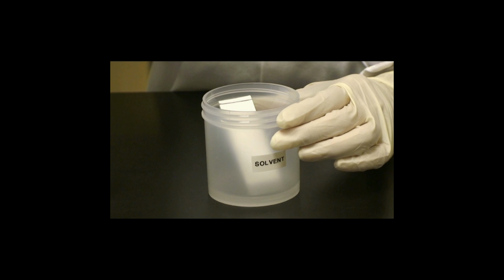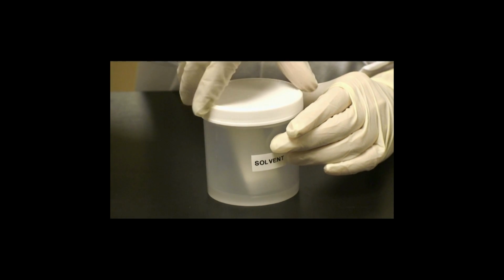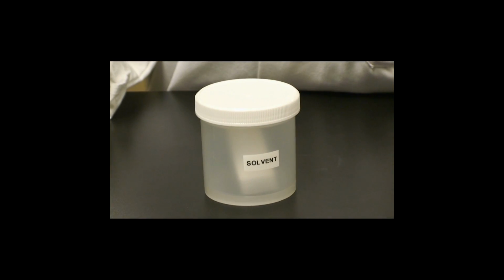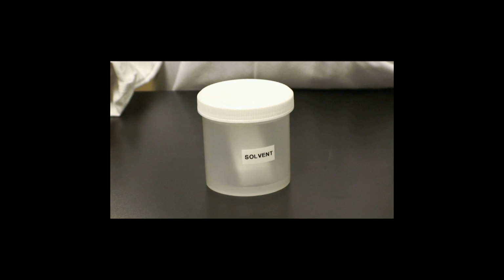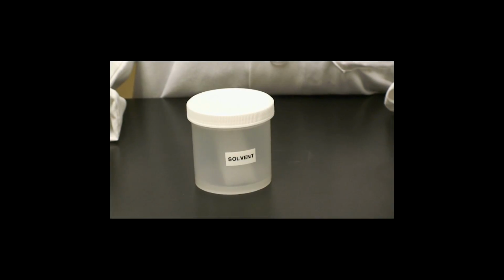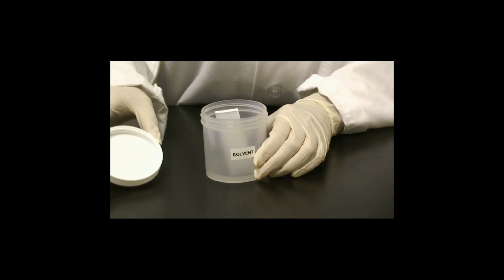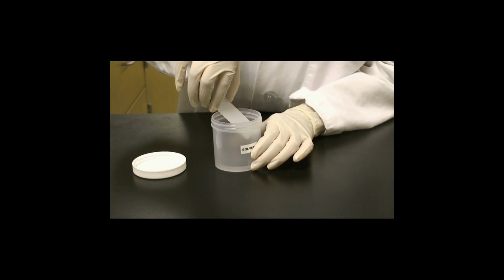The solvent chamber should be on a flat surface to allow even distribution of the solvent as it wicks up the TLC plate by capillary action. The solvent should not slosh around once the TLC plate is placed into the chamber. Once the solvent has moved up to or near the barrier line, take the plate out of the chamber and let it dry for about 10 minutes. Close the solvent chamber to prevent loss of the solvent.